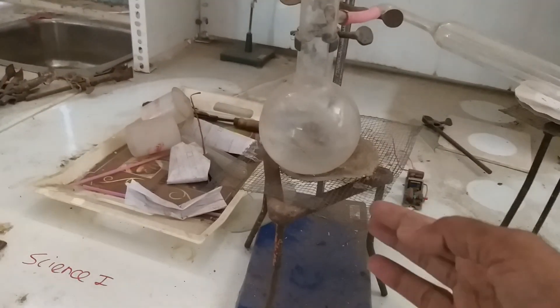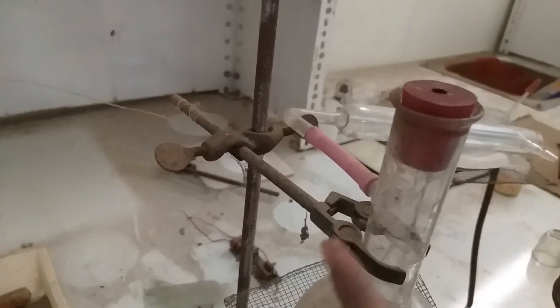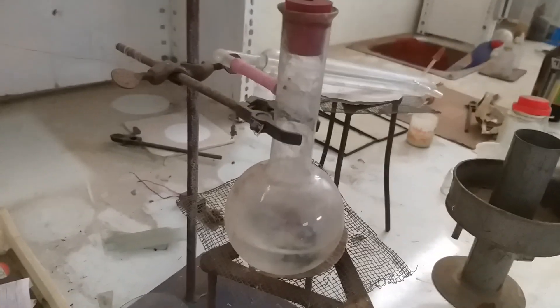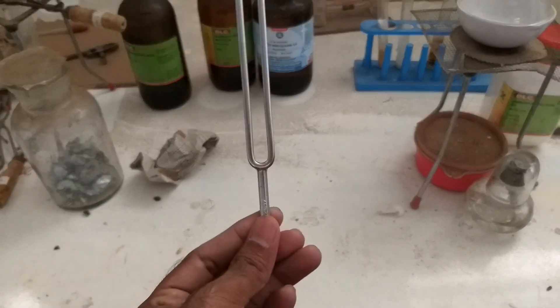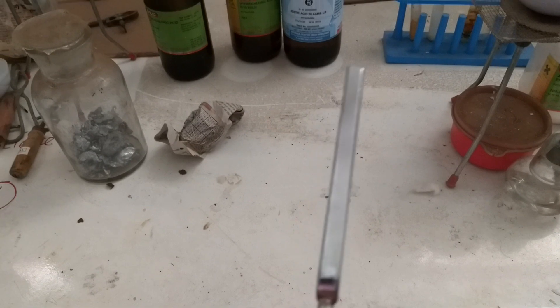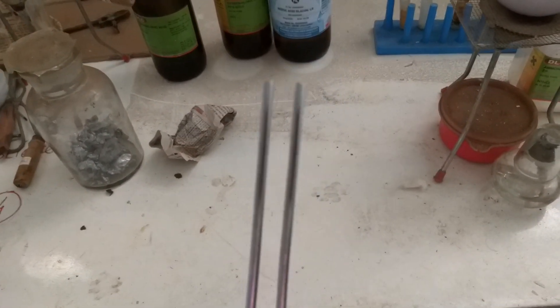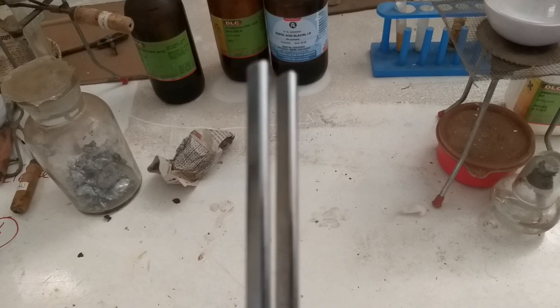This is a wire gauge, this is a tripod stand, and this is a clamp used to hold vessels in position. This is a tuning fork — when I hammer it, it creates many vibrations and sound. The vibrations can be easily understood.